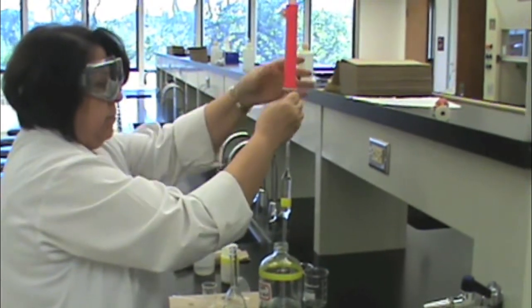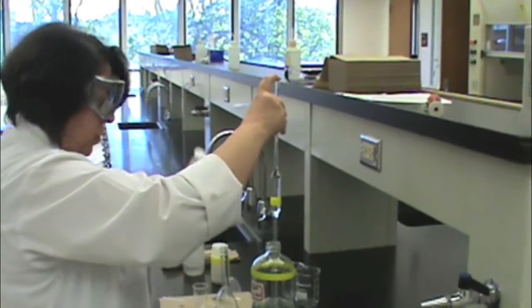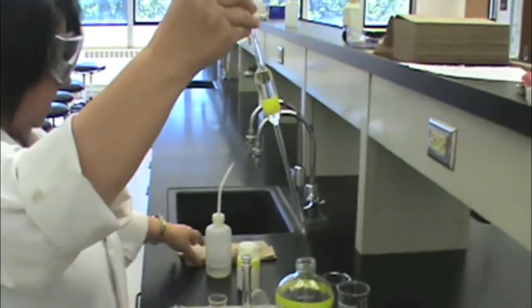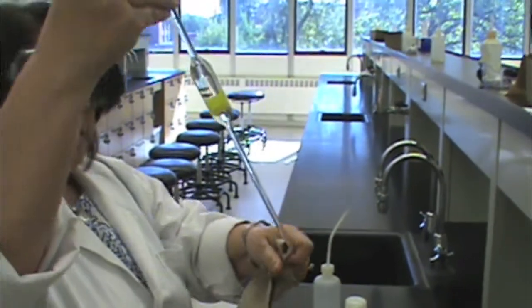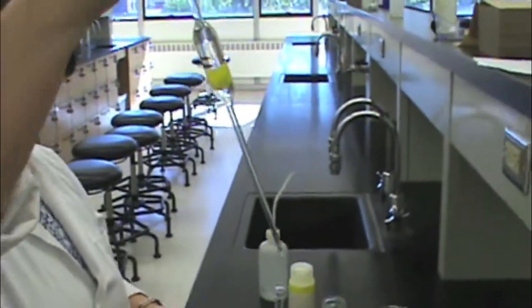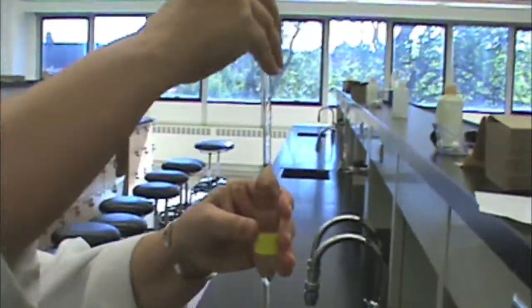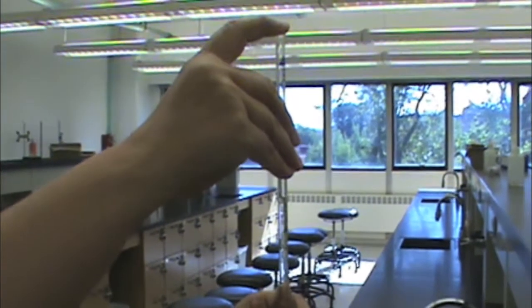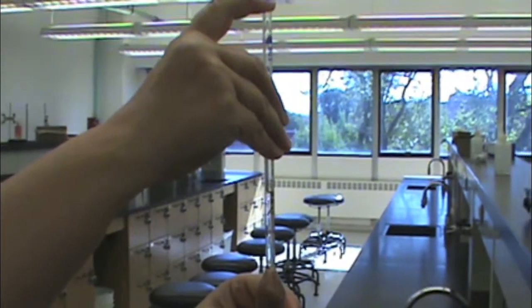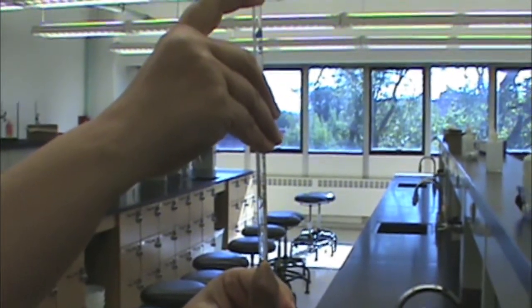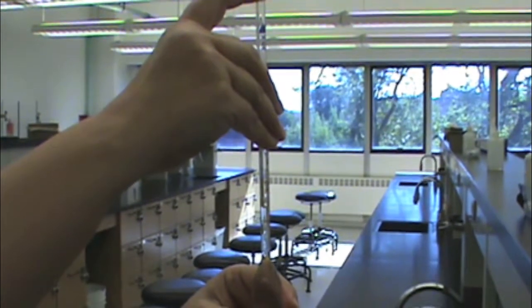Remove the pipette filler and place your finger over the hole. Then wipe the pipette and gently remove your finger just slightly so that the level of the liquid in the pipette drains down to the line marked on the pipette.